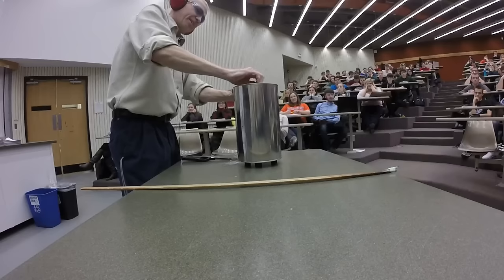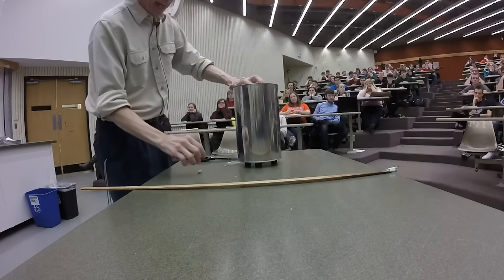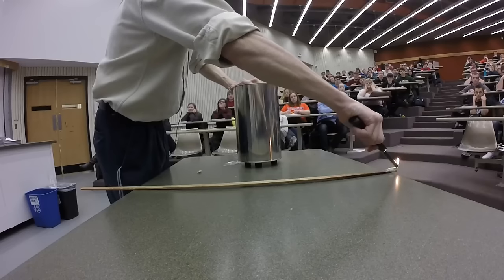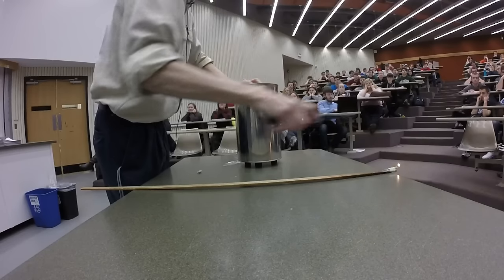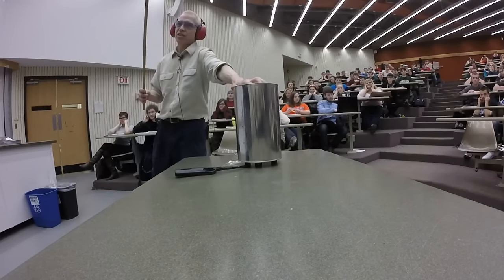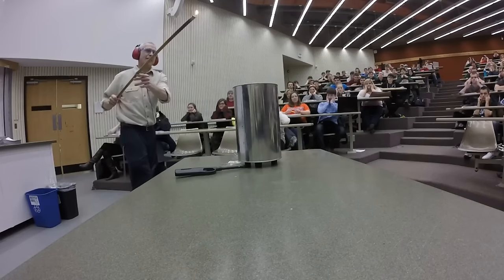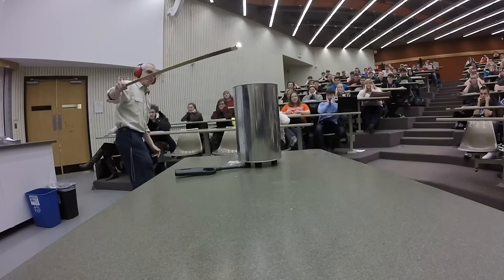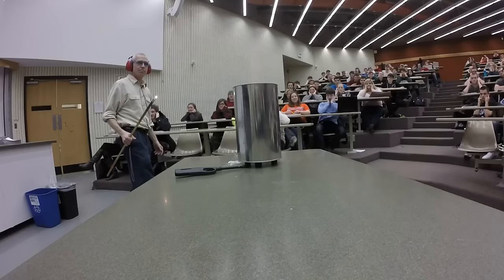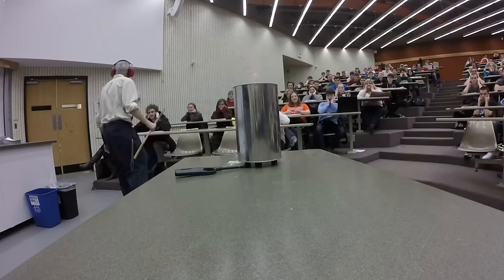And now, on the top here, I have an opening. If I light this — light this baby — what happens?